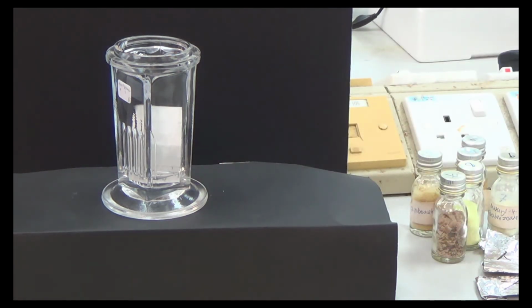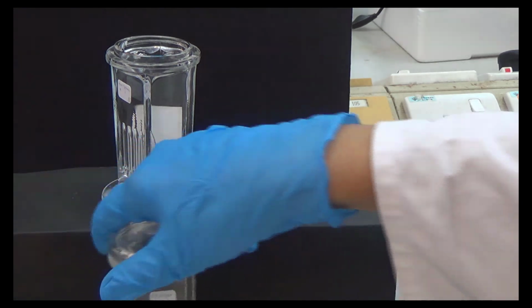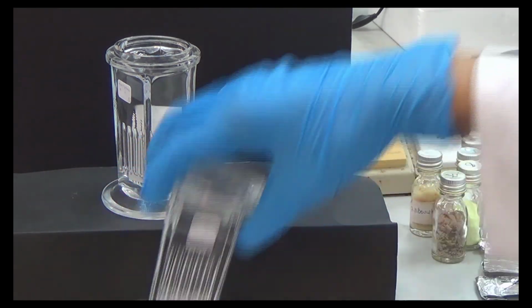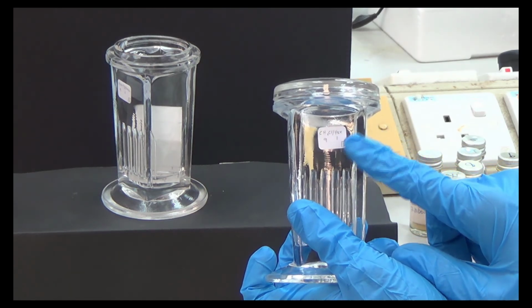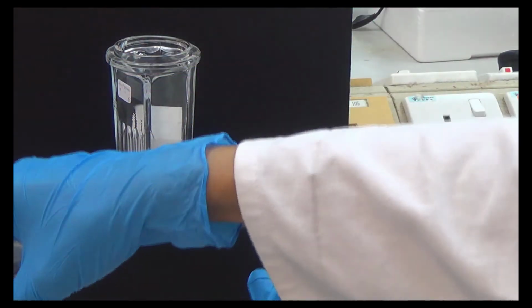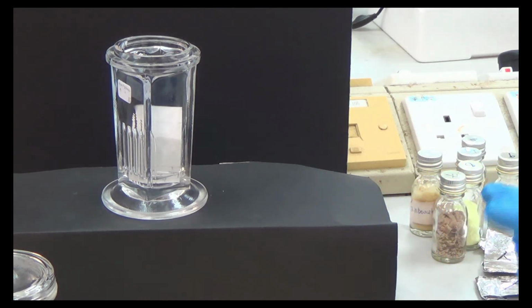That's one of the ideas. The reason why this solvent is different from the solvent we used before, which was DCM and hexane 9:1, while this one is, I think, hexane and ethanol, is because why?